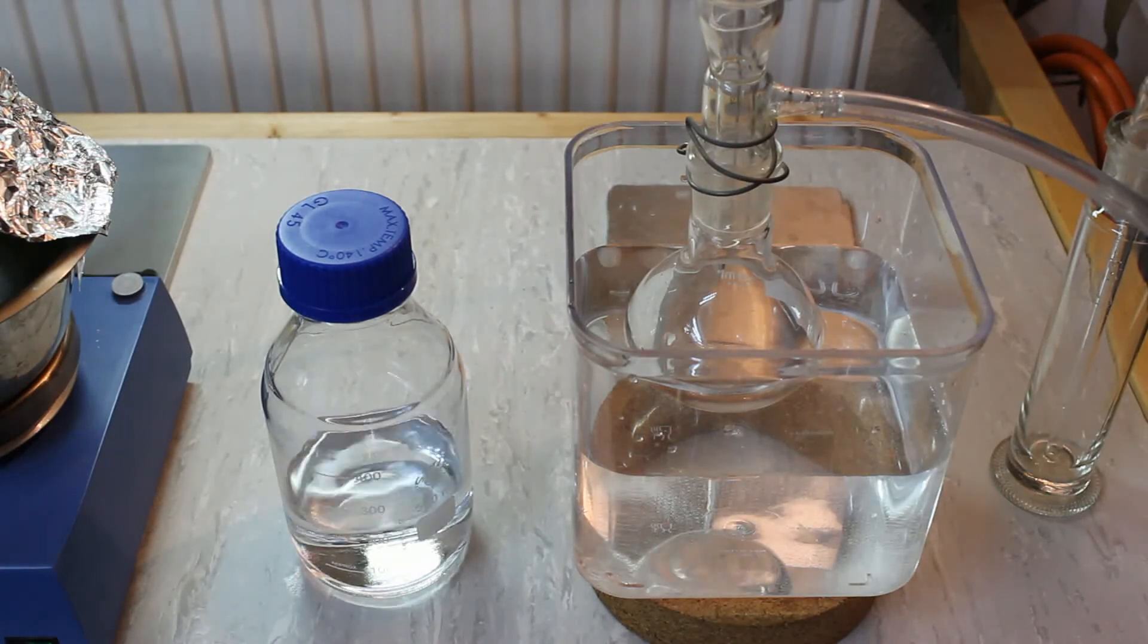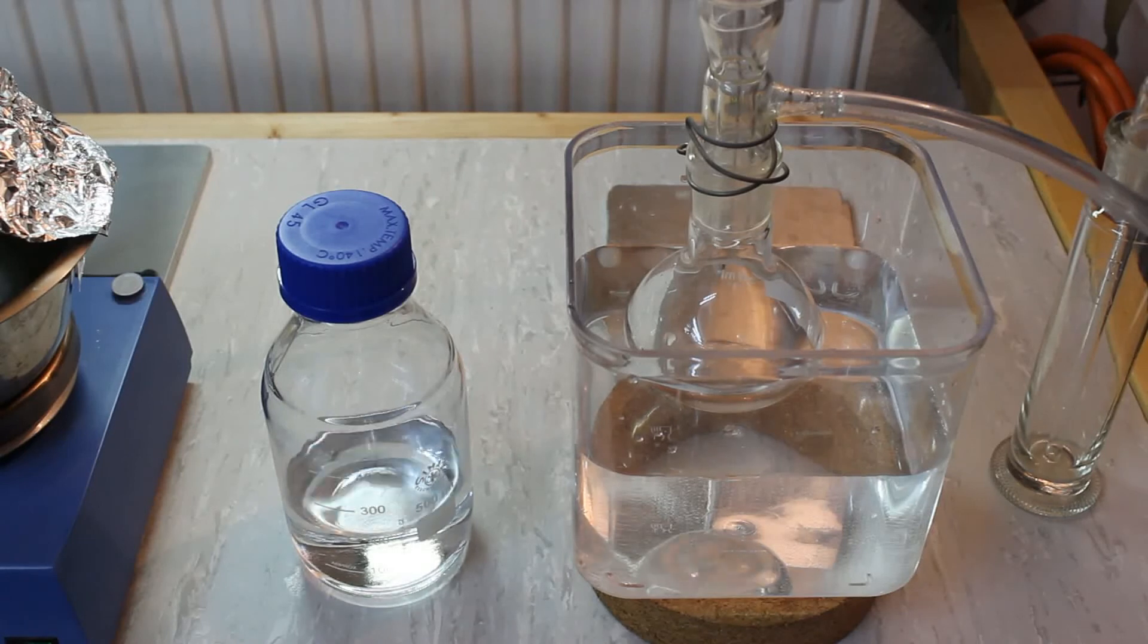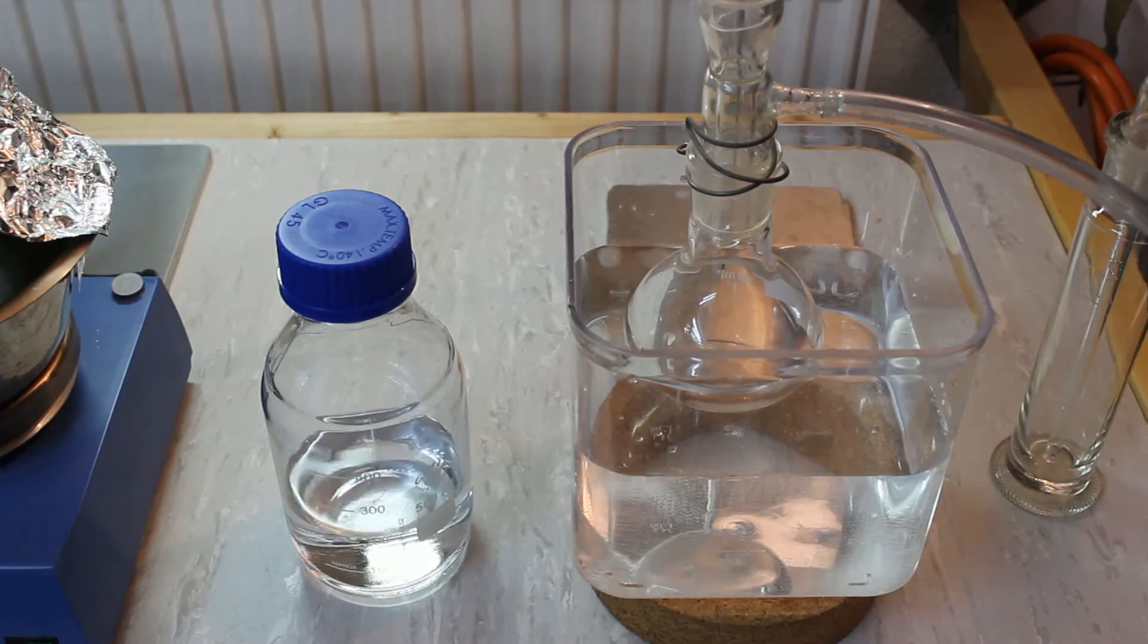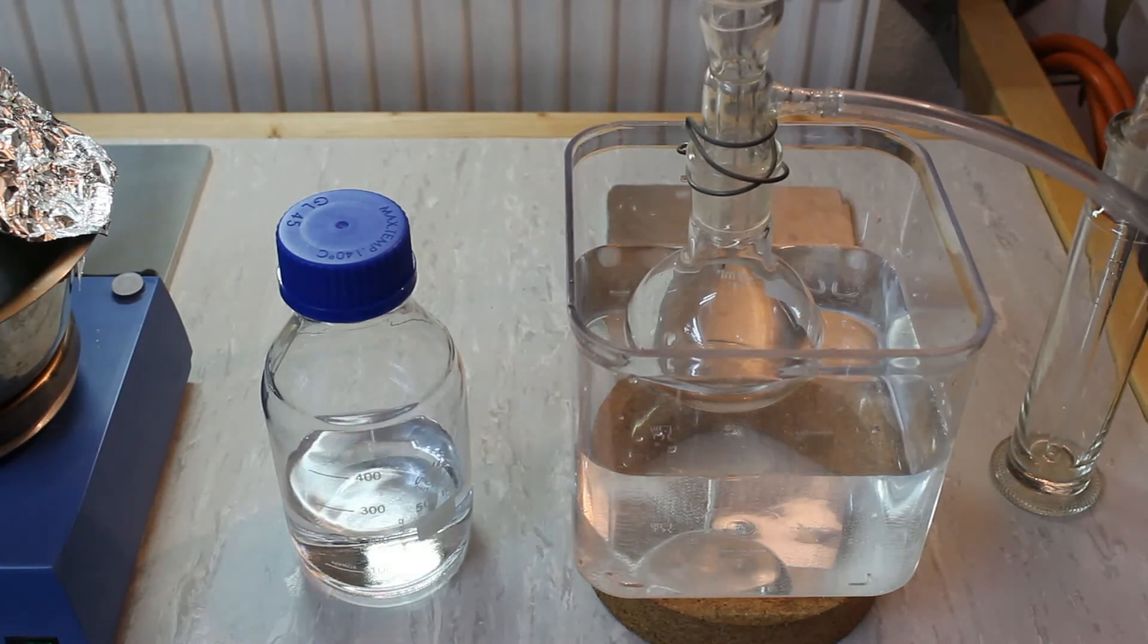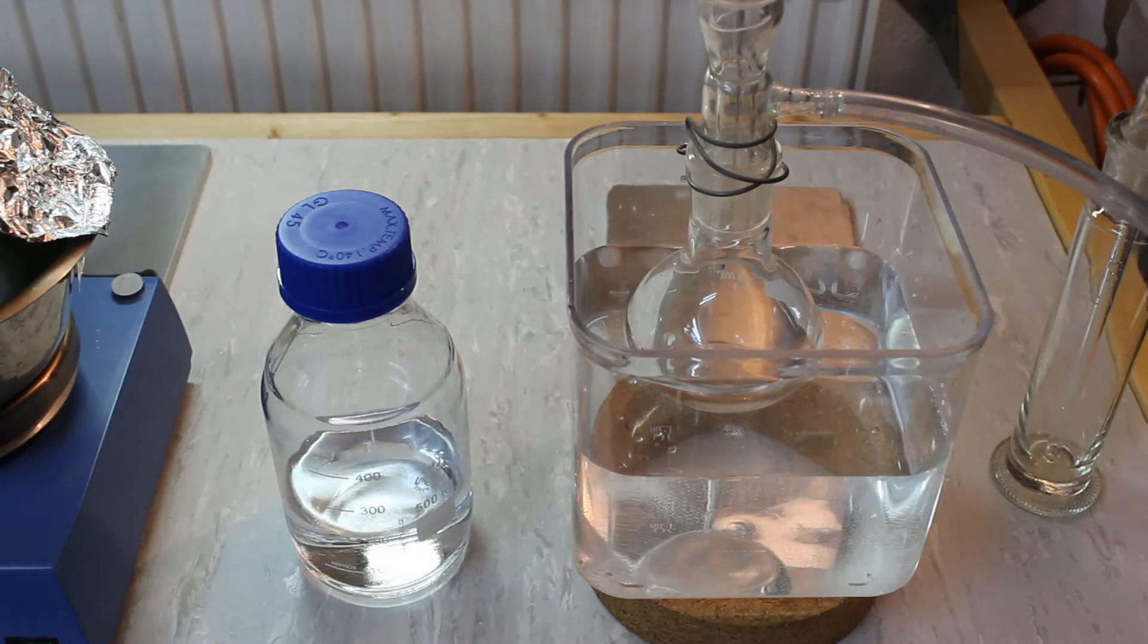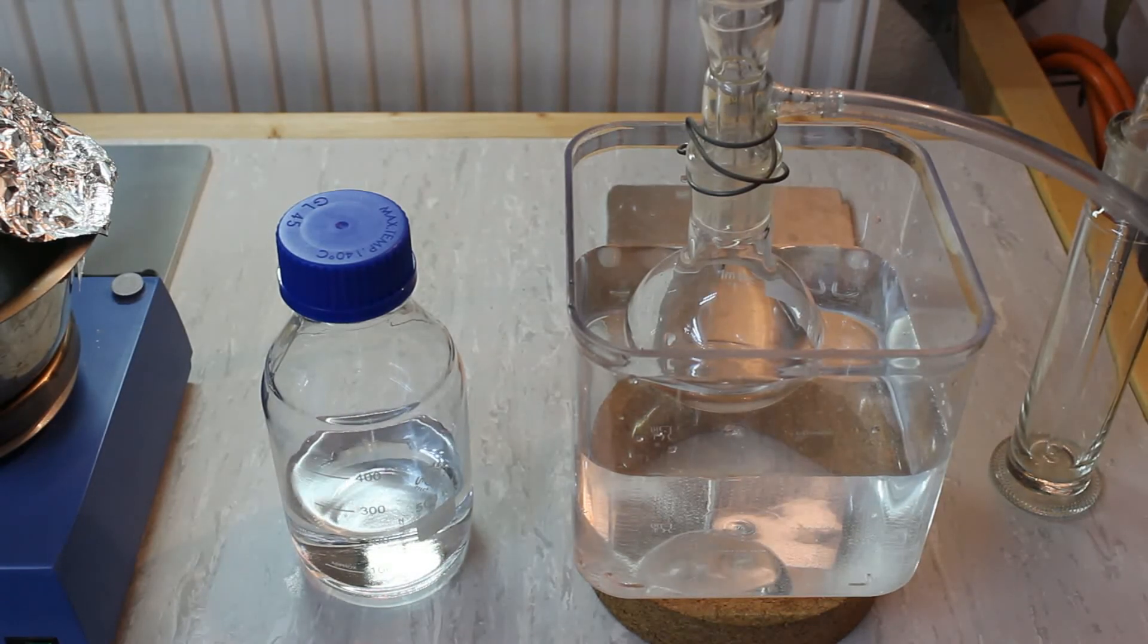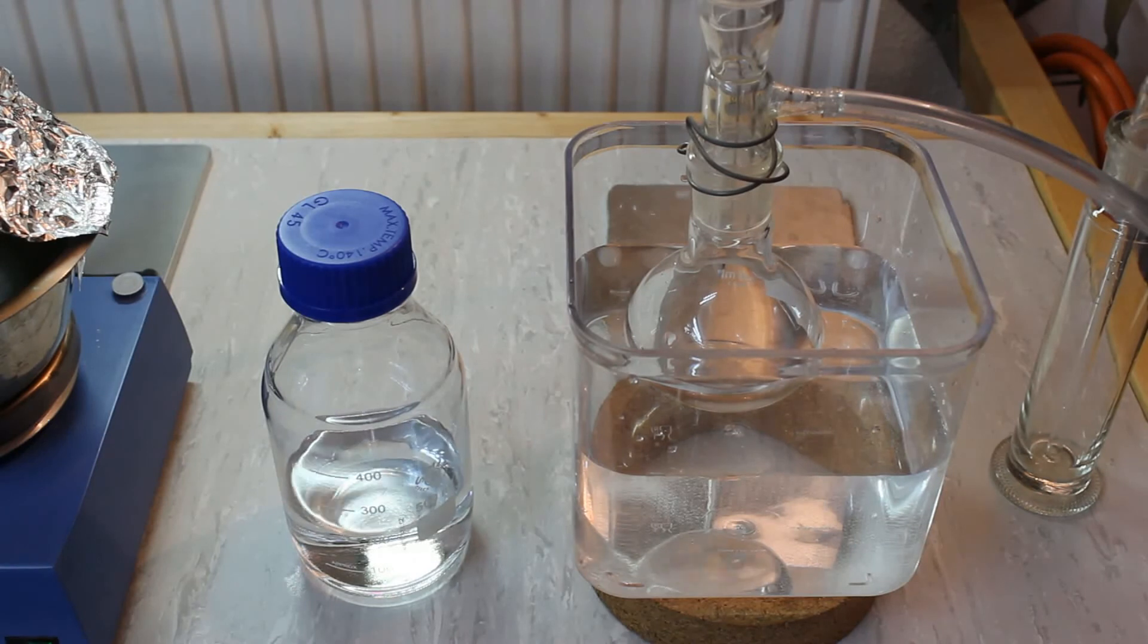I'm going to use the ether in the Grignard reaction. Once as a solvent for the whole reaction and then after workup we also need some ether to extract our product. So I basically need some ether that's absolutely dry as a solvent for the reaction and some ether where it doesn't really matter.